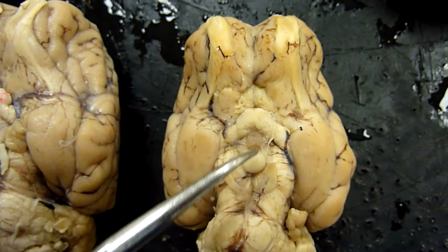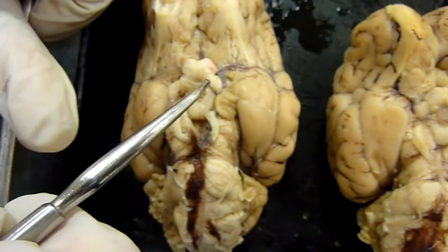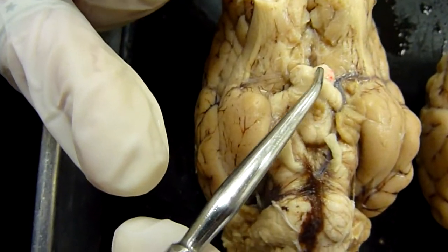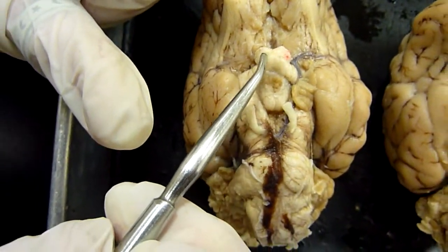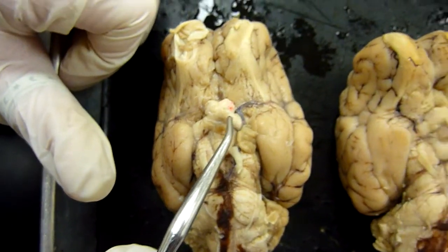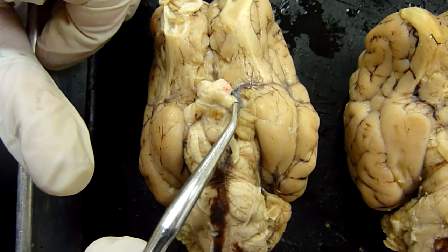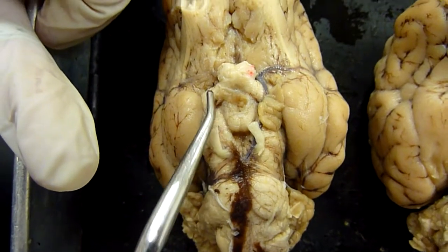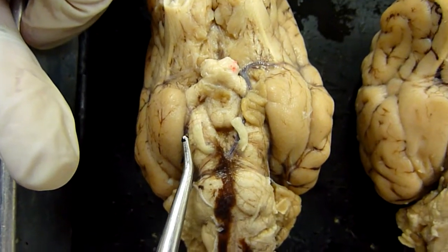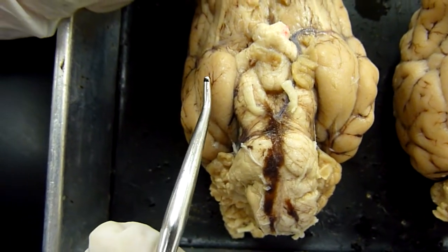Optic chiasma, you can see it better on this — it contains the optic nerve. The optic tract is right here. The piriform lobe is right there.